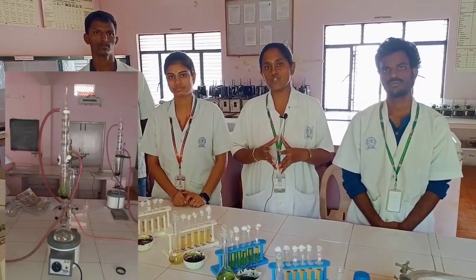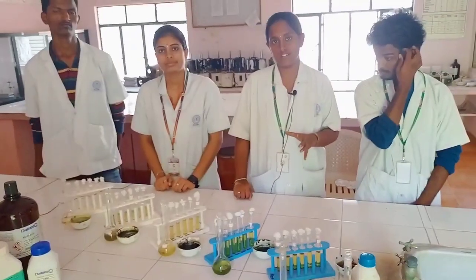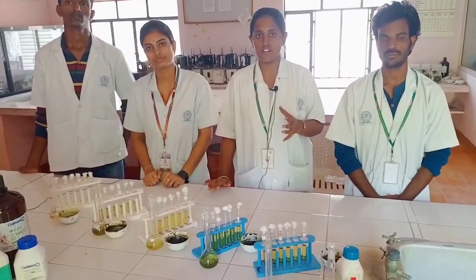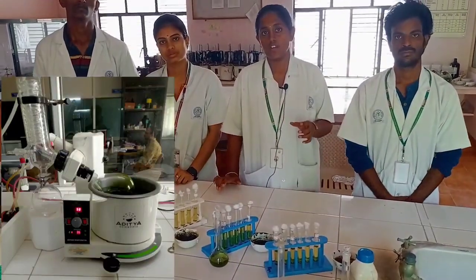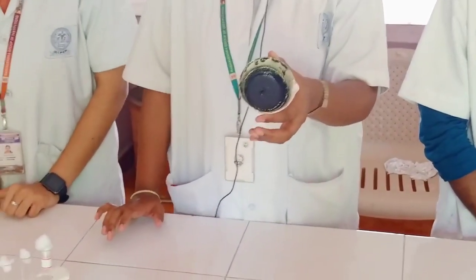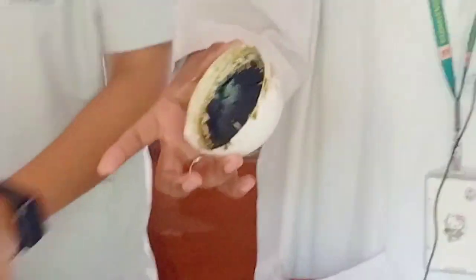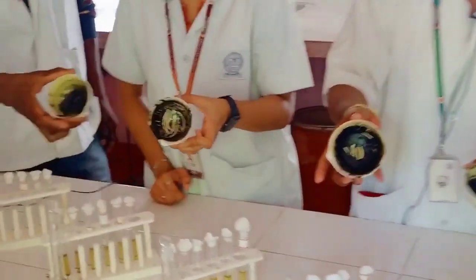The Soxhlet extraction is done by using methanol as the solvent. The extract is then subjected to concentration using rotary evaporation. We obtained a concentrated product of semi-solid consistency. We obtained all five different plant materials like this.